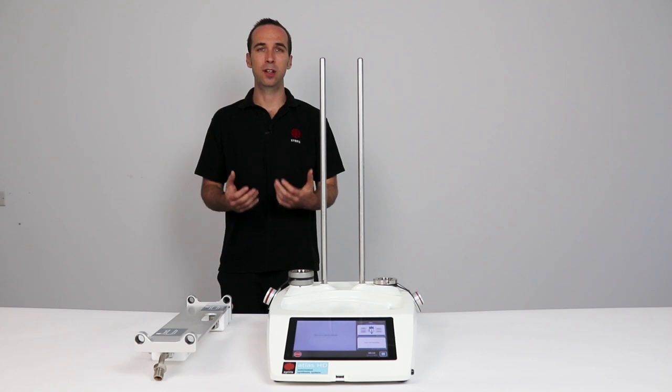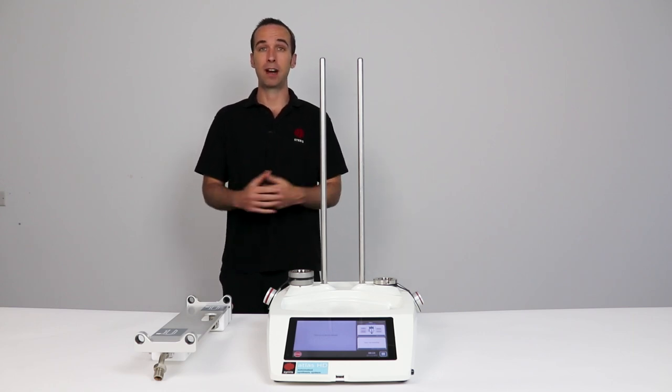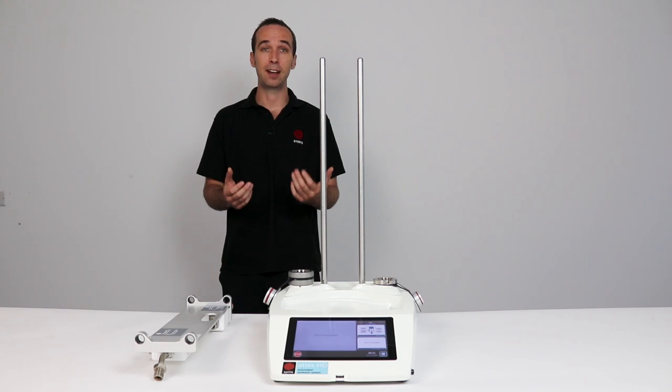The next part of the system to install is the oil drain unit. This acts as an interface between your circulator and your reactor allowing you to drain the oil back into your circulator within seconds making vessel changes incredibly quick and a lot less messy.